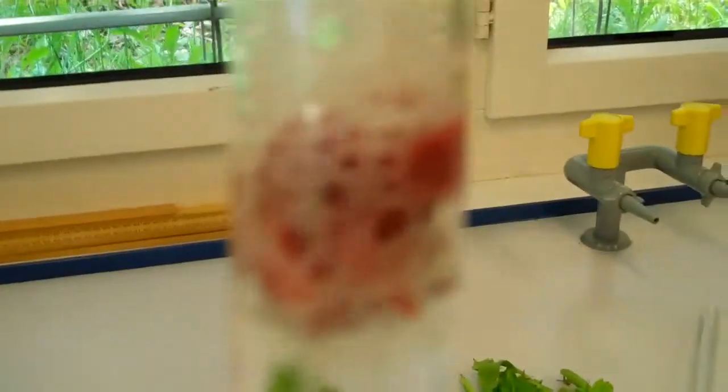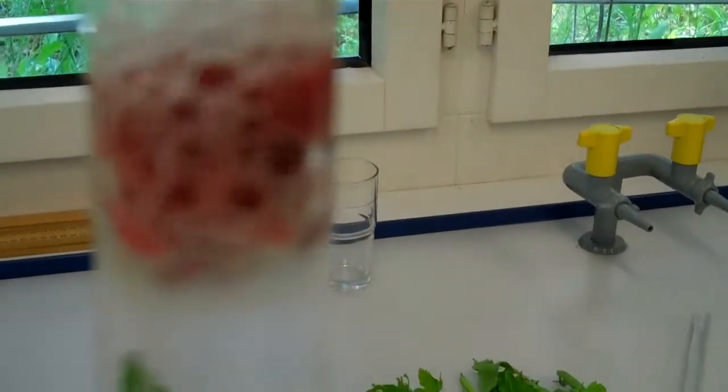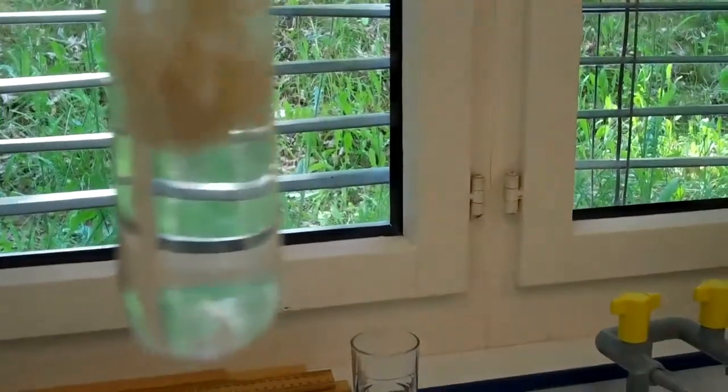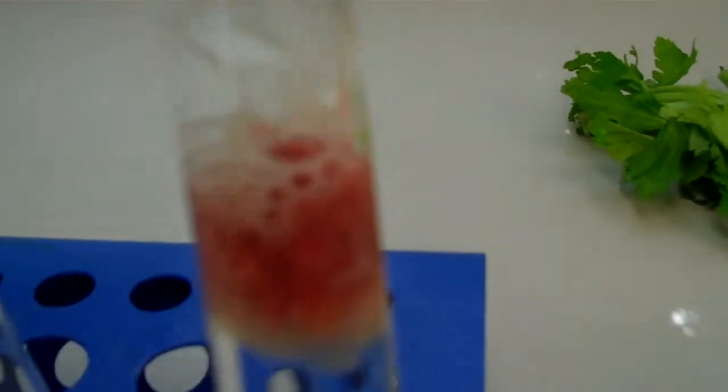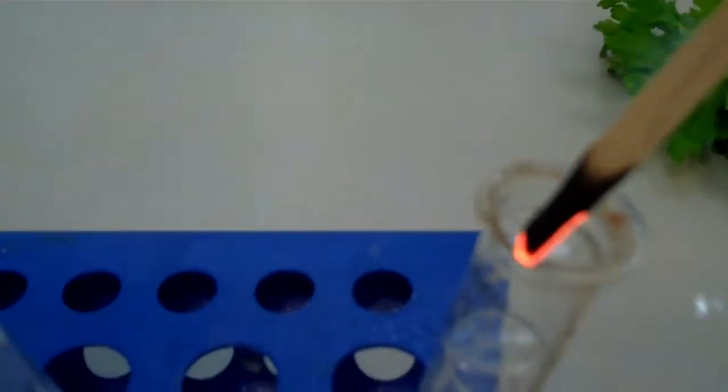Okay, now liver contains the best enzyme, the best catalyst for this reaction. You can see we get lots of bubbles of oxygen gas. Potato, we get quite a few bubbles. Celery, a few bubbles. Looking at the bread, it doesn't appear that it contains any enzymes, or maybe a few, but this seems to have the smallest number of bubbles. So liver, bubbles going all the way up the tube. Definitely the best catalyst.